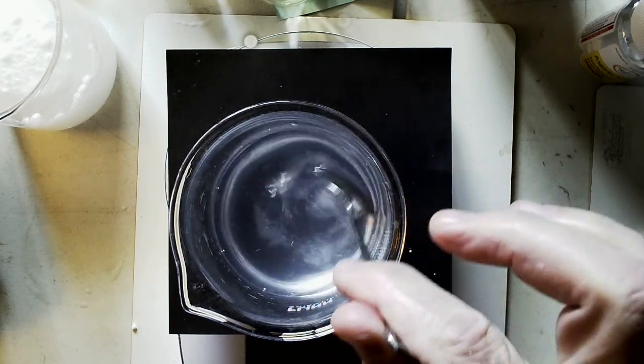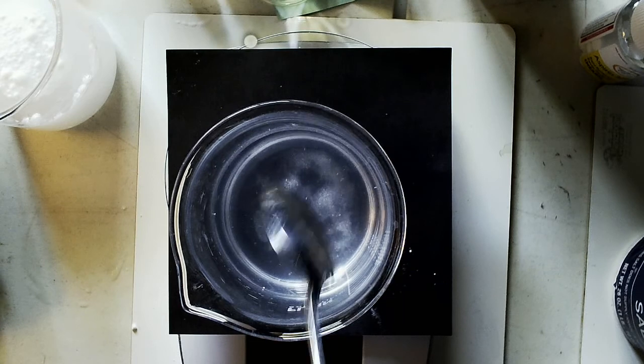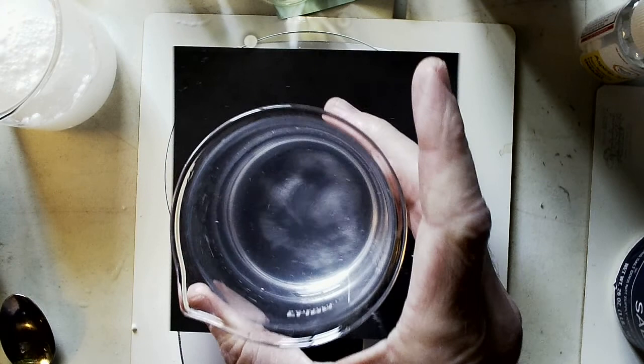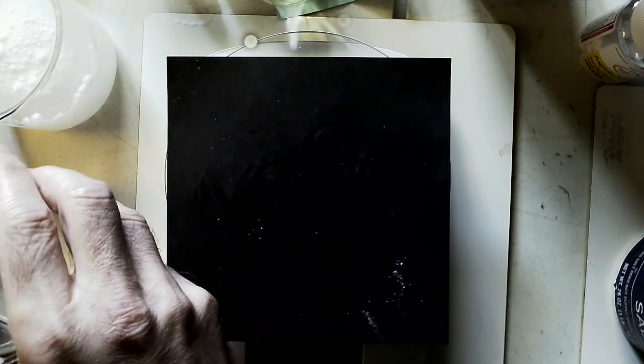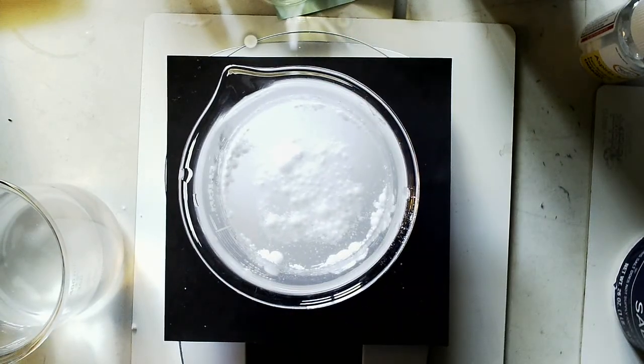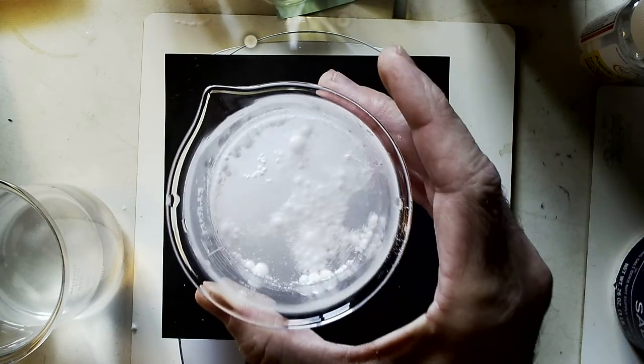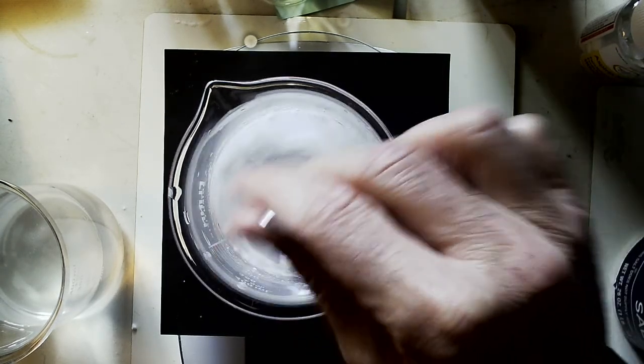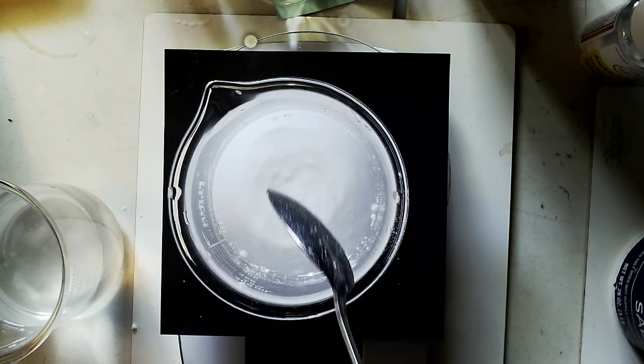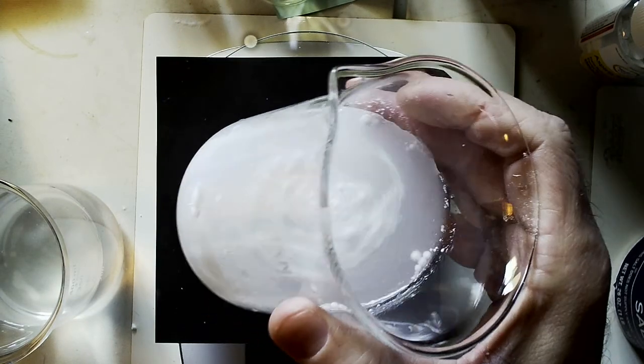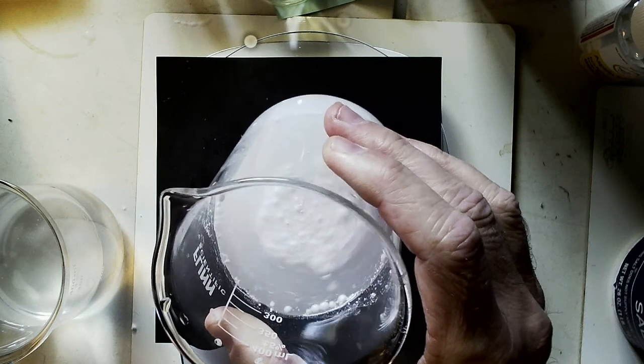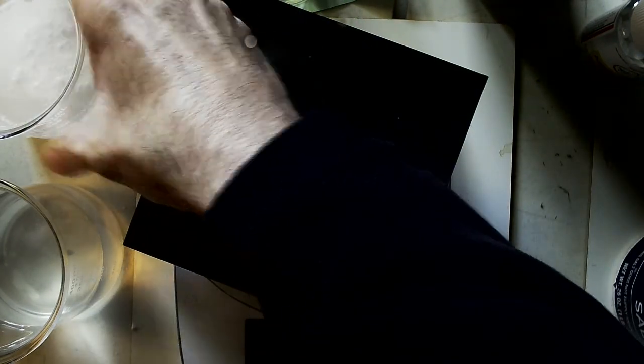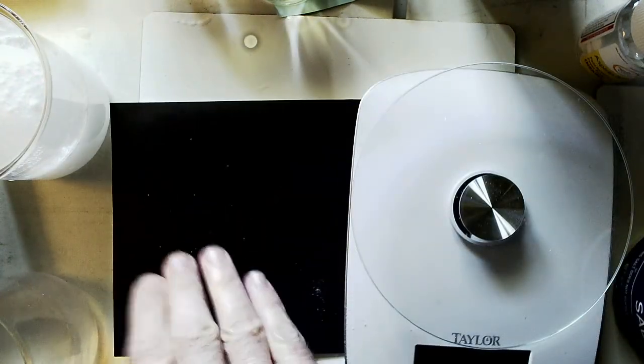If I was to leave this for a little while longer, it would probably all dissolve, but in the interest of time, we're not going to do that. But if you look at the difference between that and the aspirin, the aspirin hasn't dissolved much. I could keep on stirring that, but it's not going to dissolve too much more than that. If you were here, you could see there's a big aspirin down at the bottom of the beaker. So what we would say then is that the aspirin is less soluble in water than the salt is.